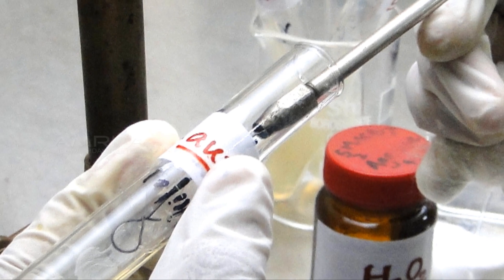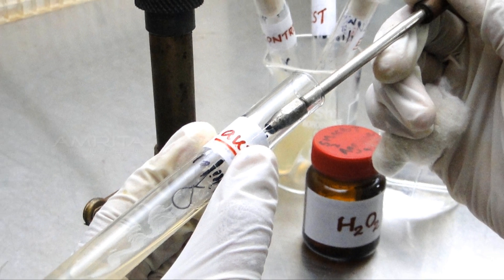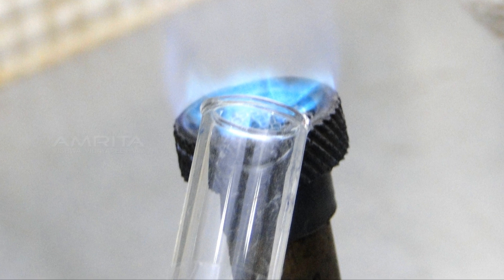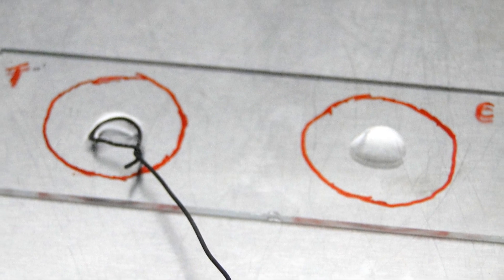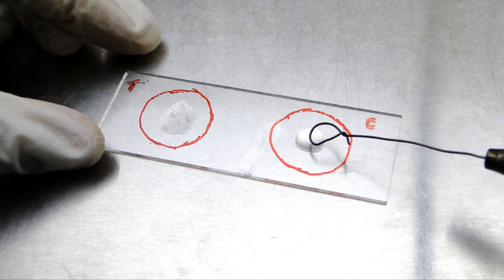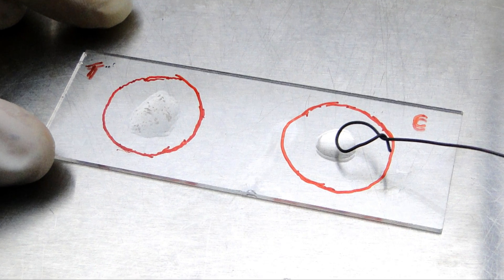Using the inoculation loop, take a small colony of the organism from the test tube containing overnight culture. Again flame the mouth of the tube and close it. Now transfer the colony into the marked fields on the glass slide. Emulsify the colonies on each drop to make a smooth suspension. The smear should be about the size of a pea.